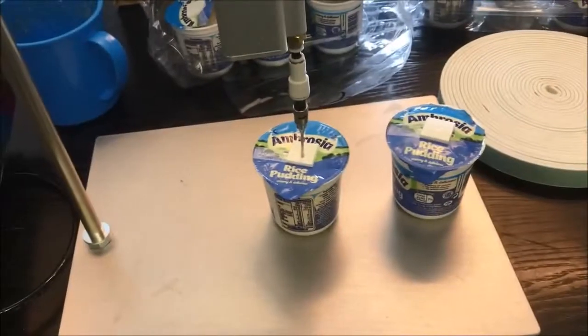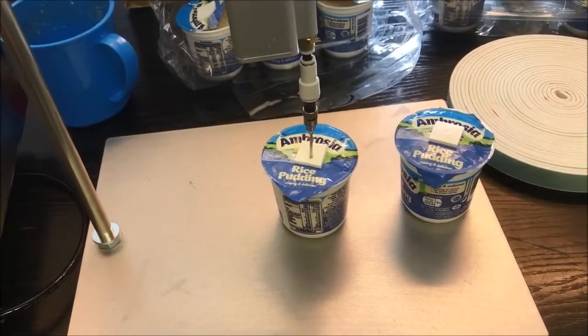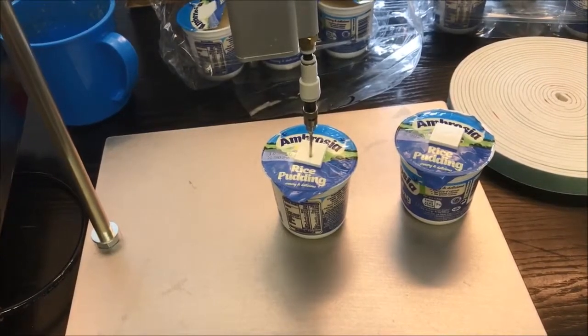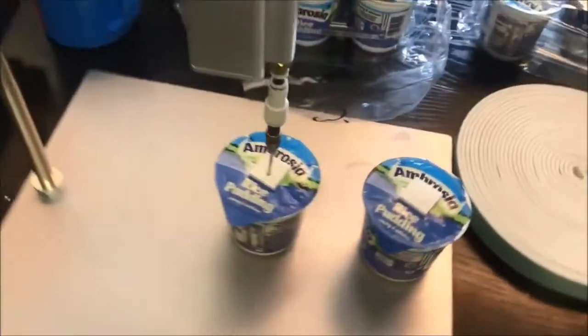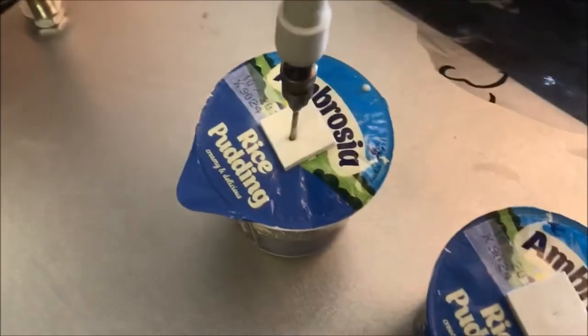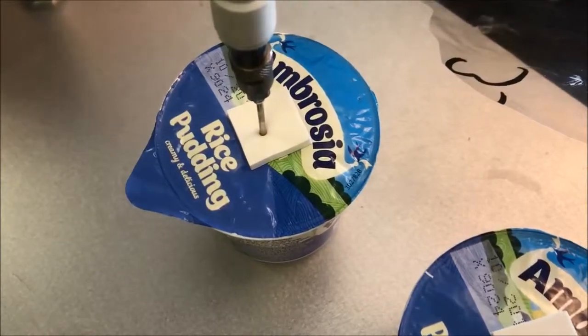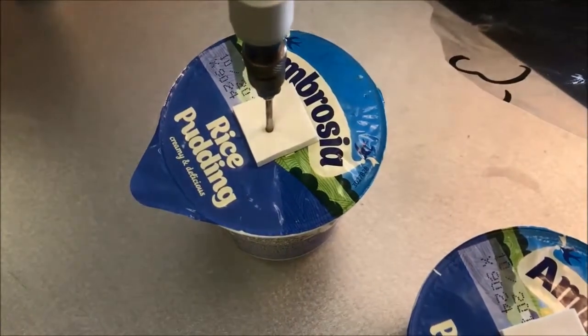Let me show you again. I'll leave the camera pointing at this so you can see the initial inflation as we start the test. You can just see the lid lifting up a little bit. In fact, if you look closely, you can see where the leak is already. It's around here, just there. Look, you can just see a little bit of liquid coming out. There's a tiny little pinhole.